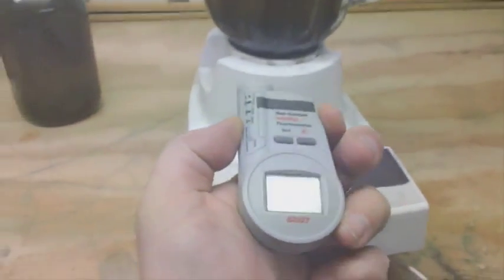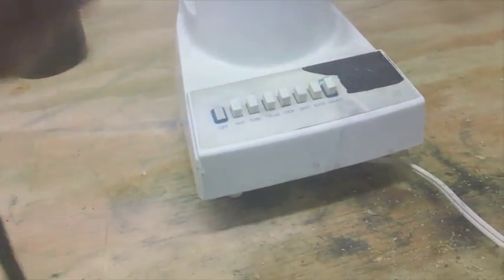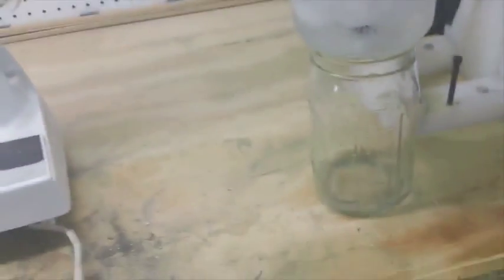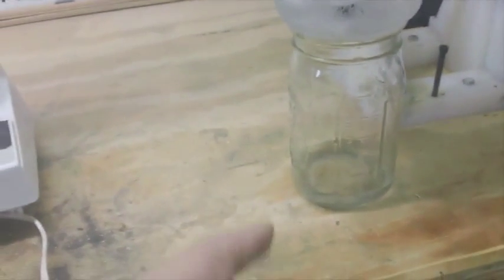The temperature of this is about 135 degrees, and I ran it for a complete hour. It doesn't seem to get much higher than that. The condenser exterior is about 55 degrees and the acetone is about 71 degrees. This system seems to work. If we're going to build a closed-loop system that makes graphene continuously, I need a way to do this — I'm recovering the acetone and using the cooled acetone to add back to the blend to bring the temperature down as well.